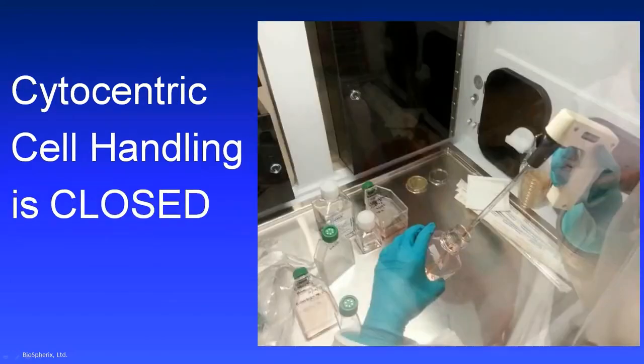For cytocentric cell handling, you have a closed cell processing space. So you have tanked filtered gases, physiologic oxygen, constant CO2. You have 37 degrees atmosphere. You can have 37-degree floor. The cells are never out of optimum. And because this whole module is at incubator conditions, it's actually like being able to reach your hands into the incubator and do everything you need to do with your cells without the cells ever having to come out into people-centric room air conditions, which is non-physiologic.